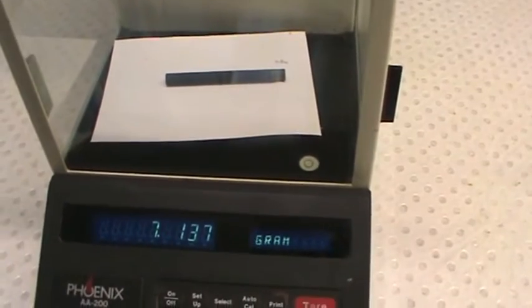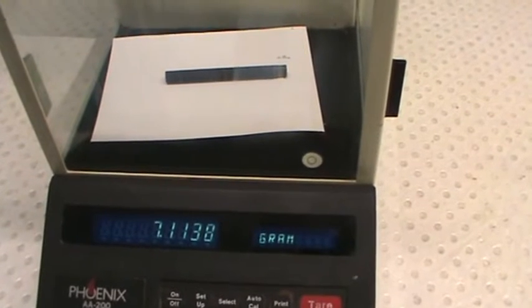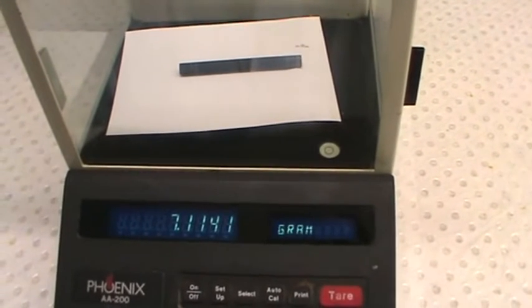Before the experiment, weigh the pre-cleaned graphite electrode on a balance, which is 7.1 grams.